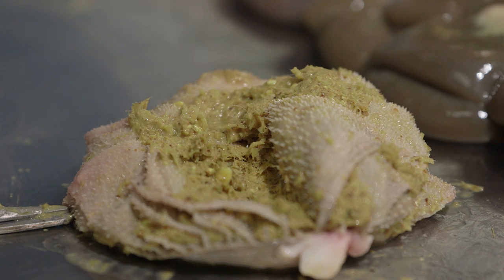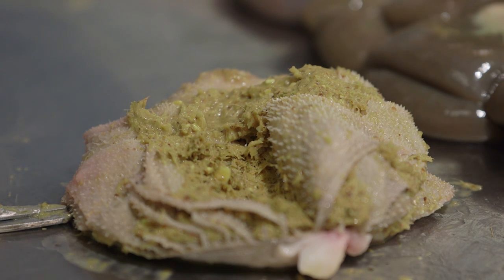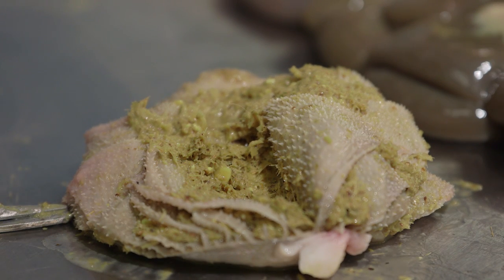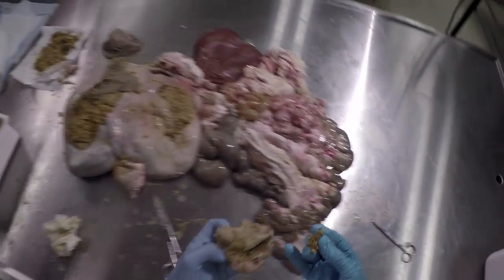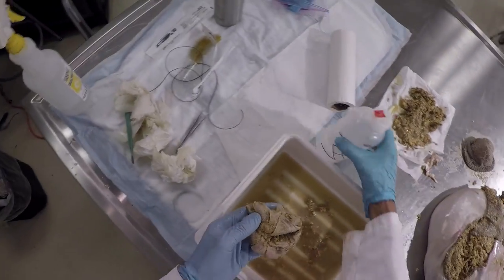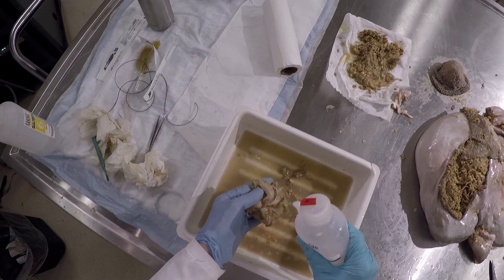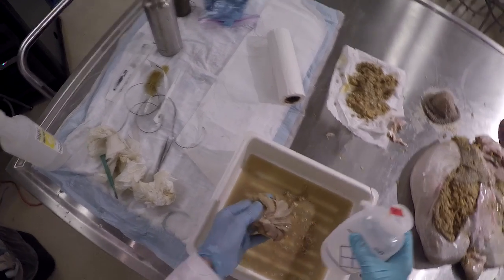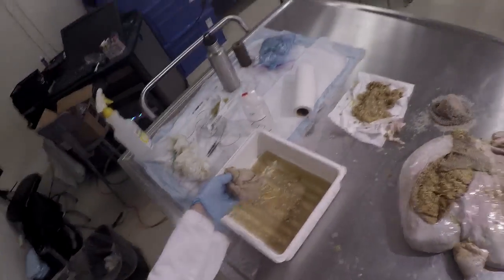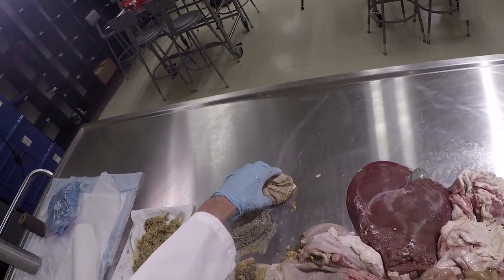And that then becomes a very effective filter at allowing only the smallest material to move any further down the digestive tract. So, a very important structure, and it's what allows these ruminant animals to keep food material up there with the bacteria for a long period of time and maximize microbial digestion.